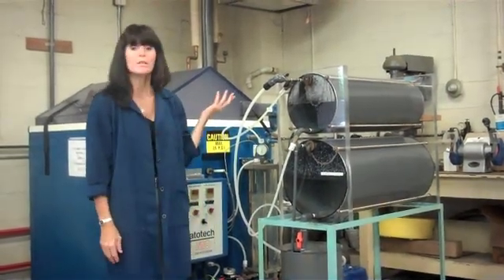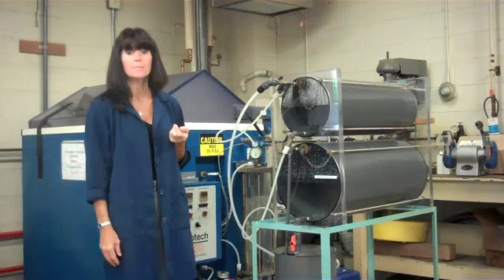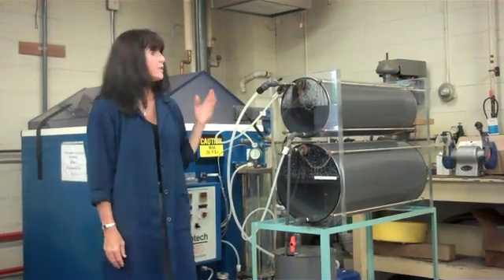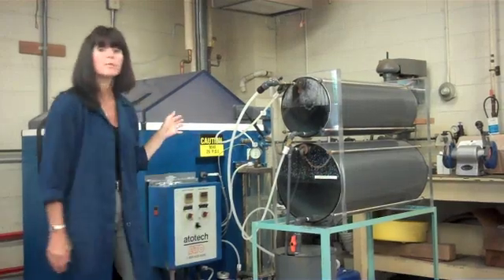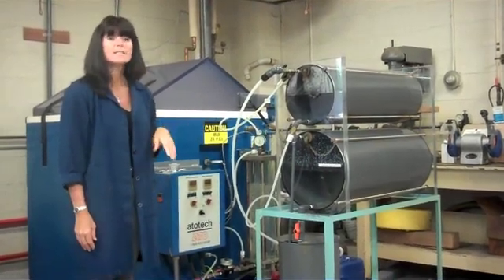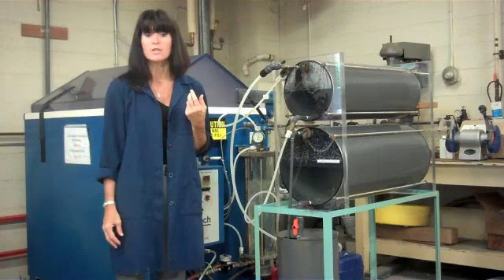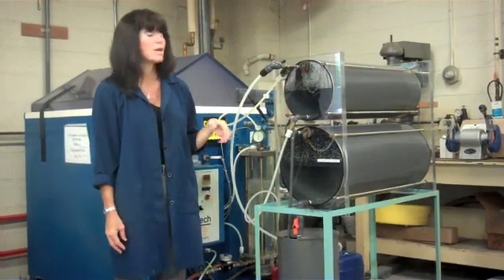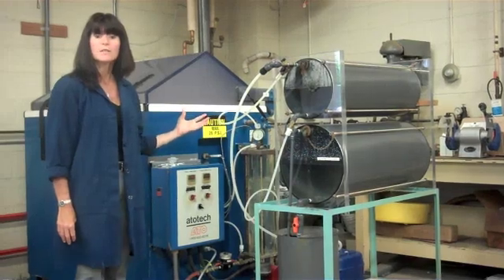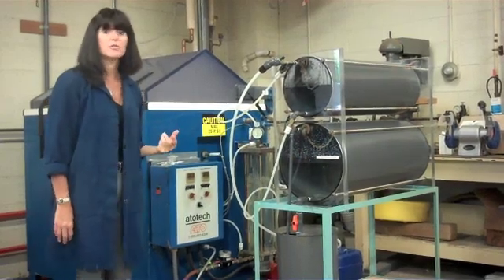Today we're going to review the standard operation of a 5% neutral salt spray cabinet according to ASTM B117. The ASTM B117 specification calls out the operating parameters and the equipment parameters for the cabinet and how those parameters should be monitored and how the cabinet is run. It does not address the types of specimens to be tested, the duration of the test, or the interpretation of test results. It is just to ensure that running the cabinet is consistent from one cabinet to the next so results can be repeatable and representative of the corrosion testing that you're trying to maintain.